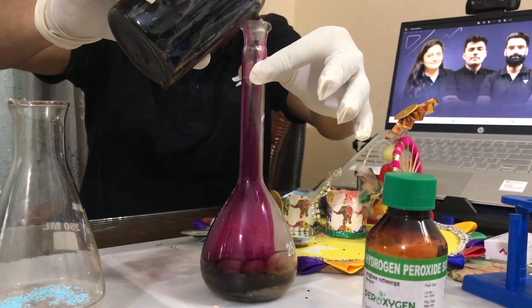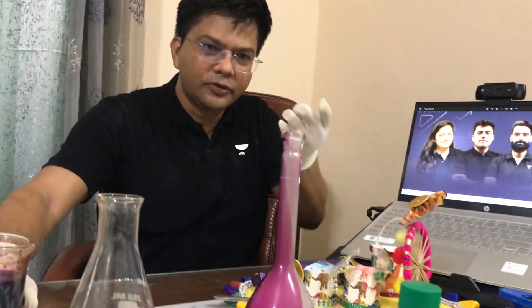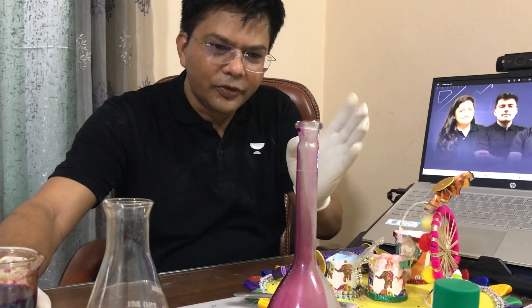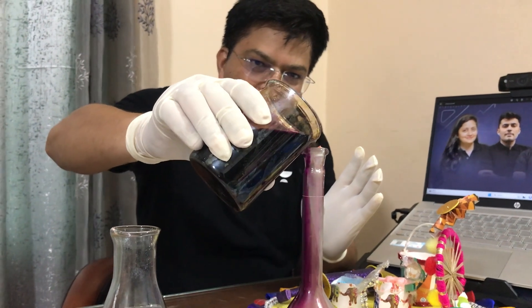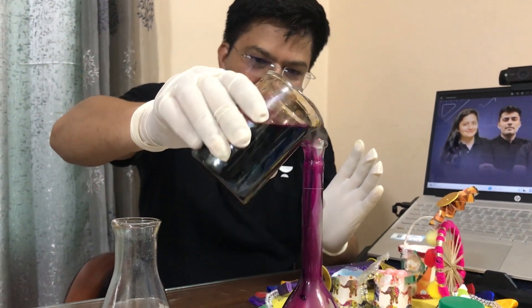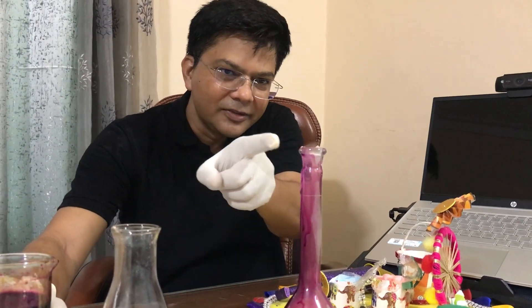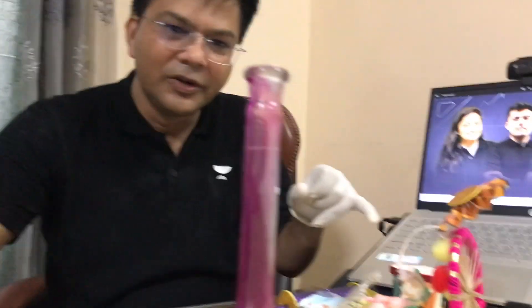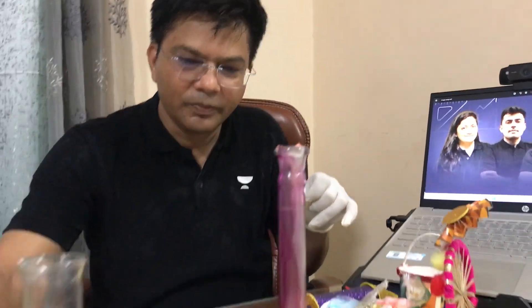Oh my god — see what's coming out! It's oxygen, kids, it's oxygen! Let me add some more KMnO4 to this. KMnO4 is a strong oxidizing agent — see what's happening over here. This is the oxygen coming out, you can see very clearly kids.